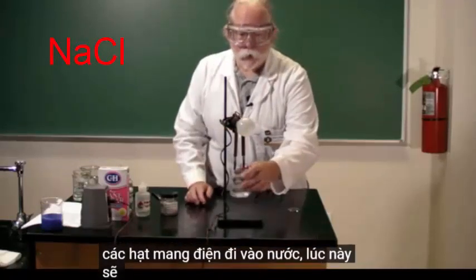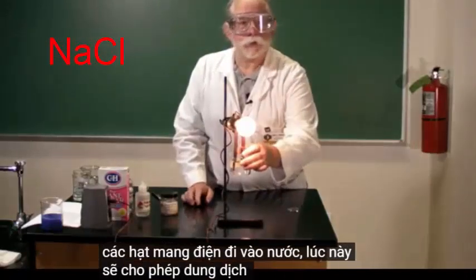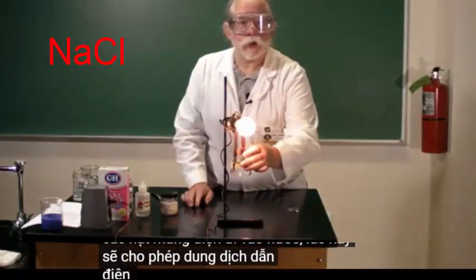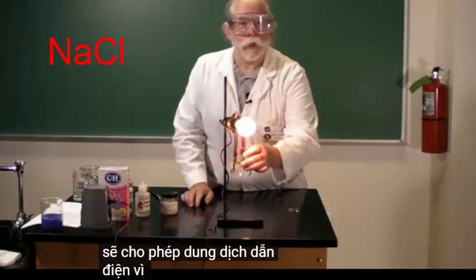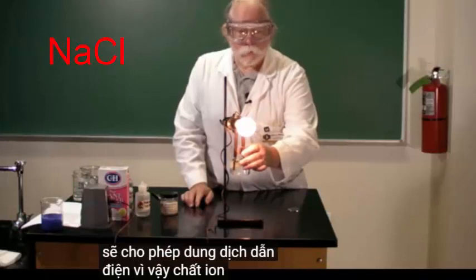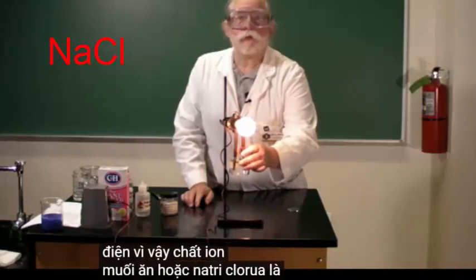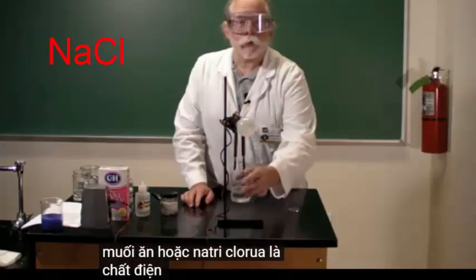This will now allow the solution to conduct electricity. So the ionic substance — table salt, or sodium chloride — is a strong electrolyte.